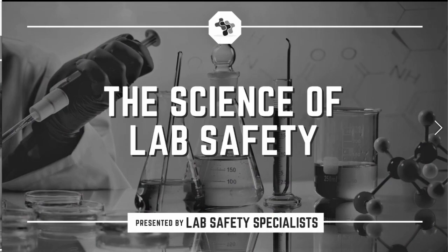Stop. Are you seriously going to add something you think is water to a potion? I'm like 95% sure, so yeah. Plus, there's already a ton of other ingredients in here, and it's less about the proportions, more about the thoughts and feelings I put in, so it's fine.